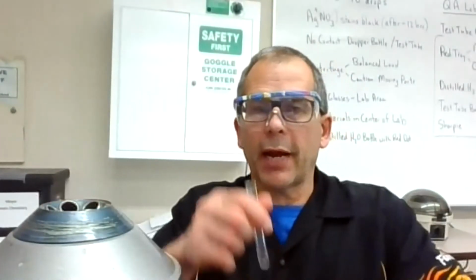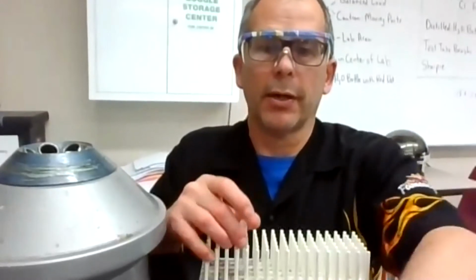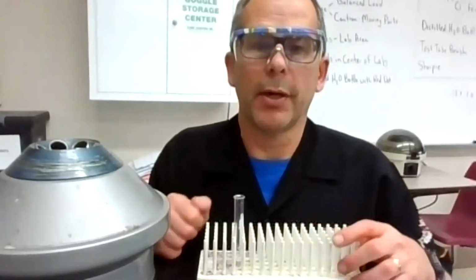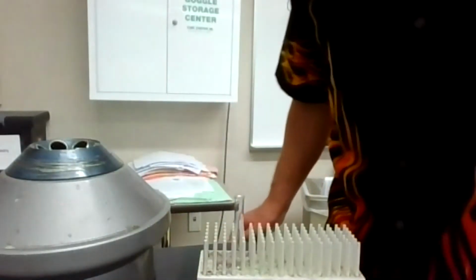Okay, let's go to a bigger screen so you can see this right here. We're going to move this over, sneak down here with a centrifuge I'm bringing in. We have our test tube. I'm going to bring a test tube rack. Should probably bring these ions over, my test solutions. If you can see that very well, I think that helps a little bit. And I'm going to get some reagents.